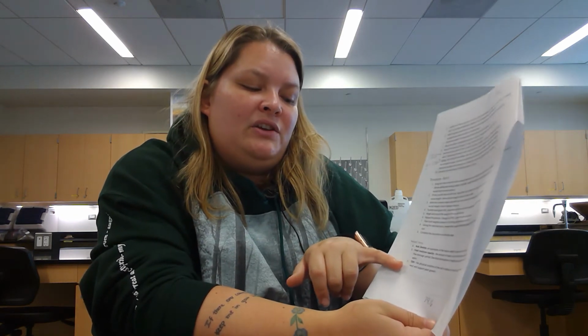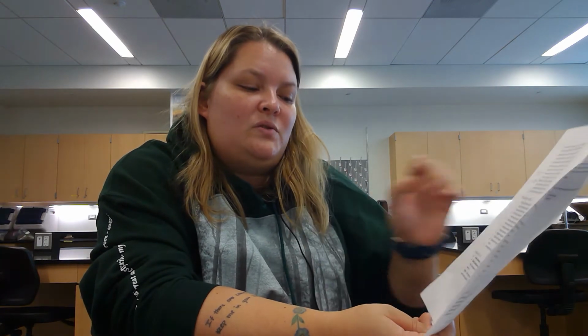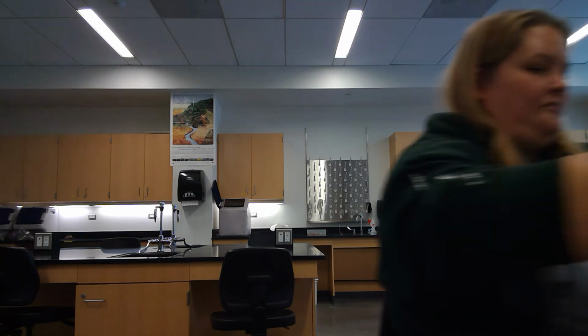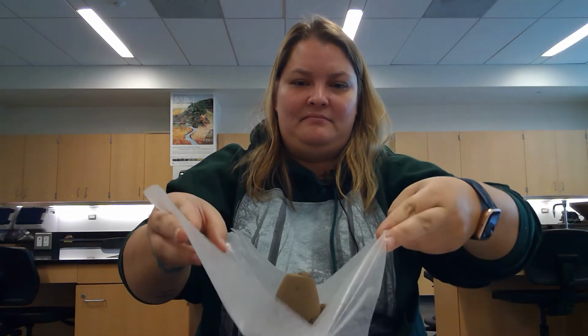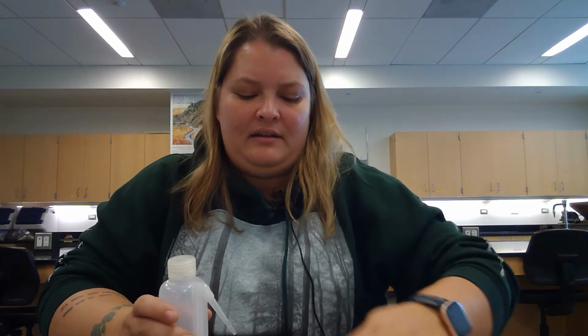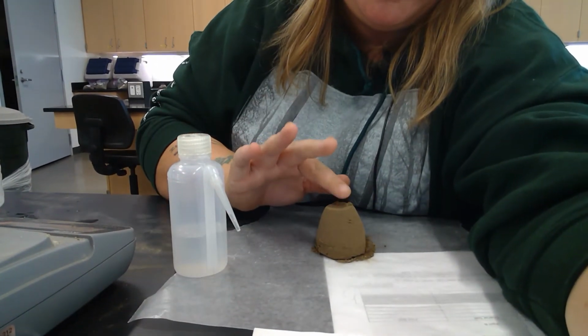And we want to bring it to good tilth, which is the physical condition of the soil in relation to its ease of tillage, capacity to germinate seed, and support plant growth. So I'm going to start with our coarse soil, that had been compacted, still staying in the shape of the crucible. And we add water, but not too much water. The soil is pretty dry, so it's not the easiest to add more water to this.